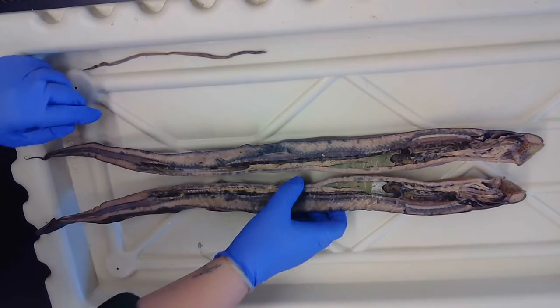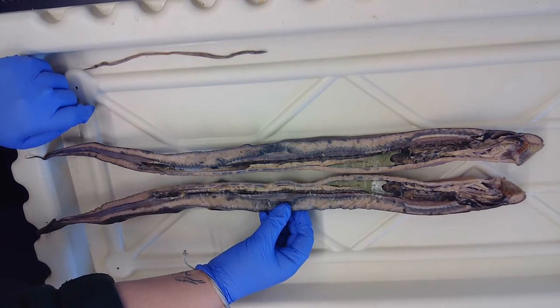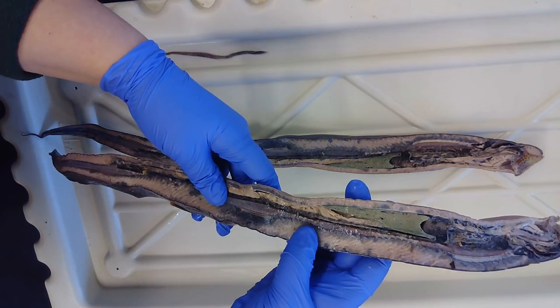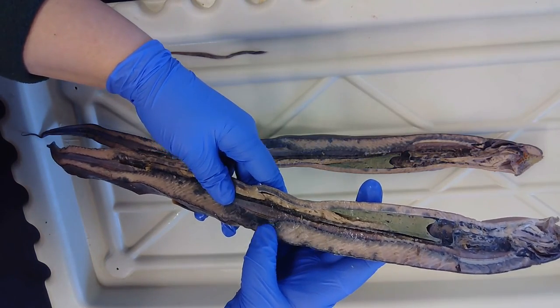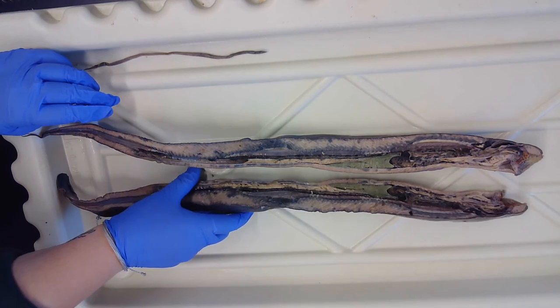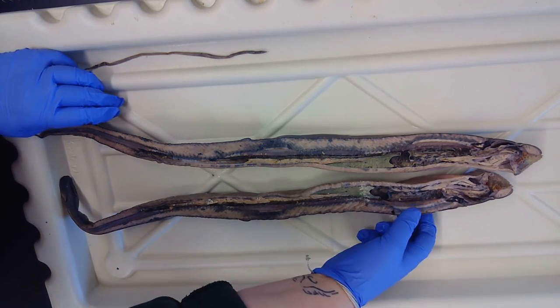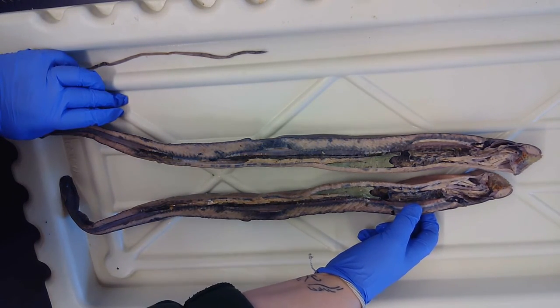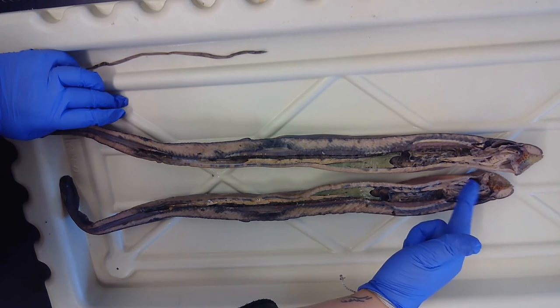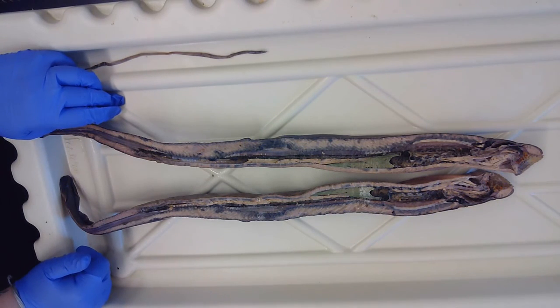And then running along that would be the spinal cord. So the spinal cord is also known as the dorsal hollow nerve cord, and that is running more dorsally past the notochord here. Also, something you can't actually see would be the endostyle, which turns into the thyroid gland in the adult lamprey, and that's underneath the pharynx area here, up anteriorly. You're unable to see it, but it is there.